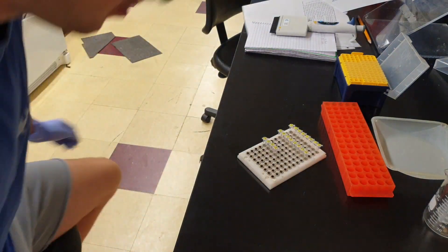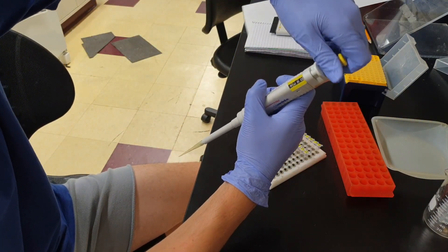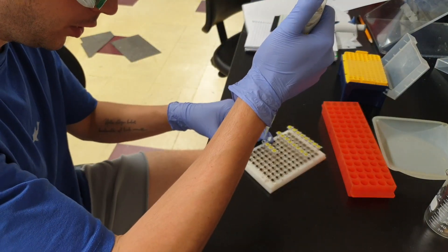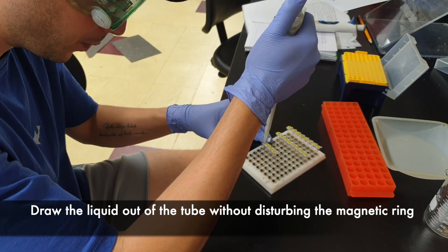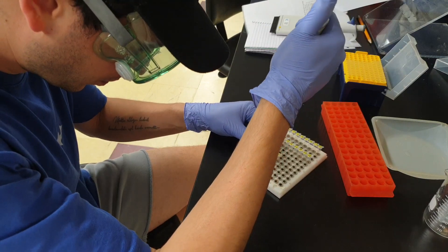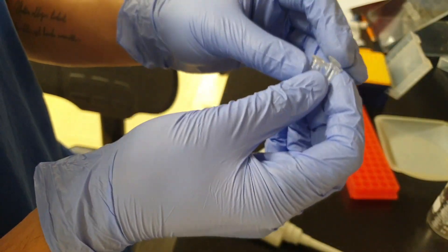It's been 5 minutes. There are about 57 microliters of product inside each tube right now, so you have to adjust the pipette to at least 57 — I'm going to go with 67 just in case. Without disturbing the magnetic ring, I will discard all of the fluid inside these tubes. At the end, what remains is just the magnetic bead pellet.